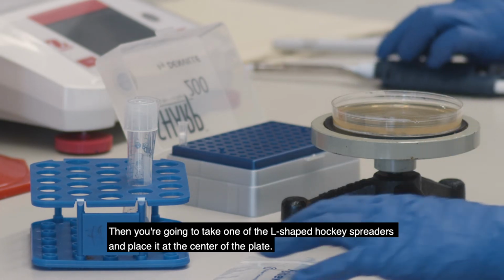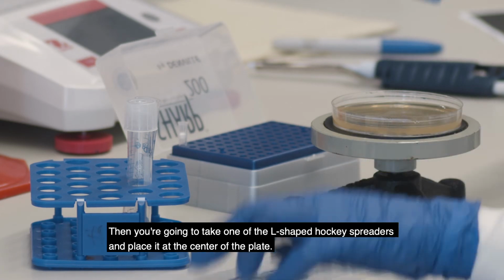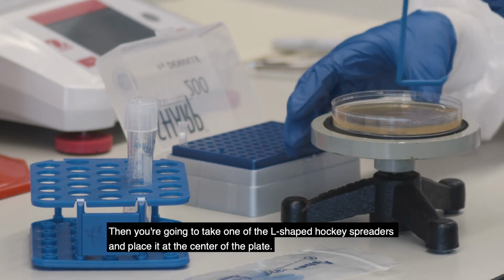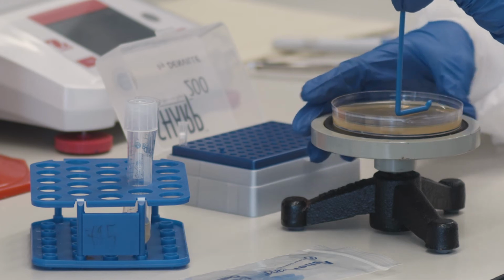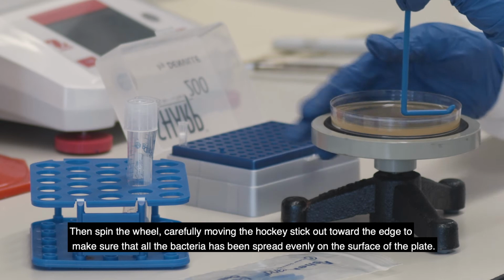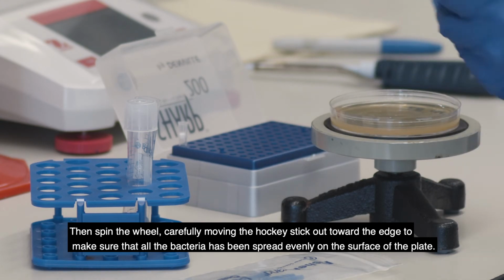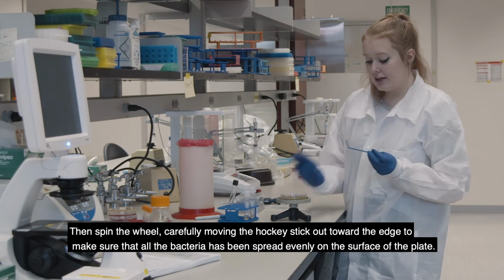And then you're going to take one of the L-shaped hockey stick spreaders and just place it at the center of the plate, and then spin the wheel, carefully moving the hockey stick out towards the edge to make sure that all of the bacteria has been spread evenly on the surface of the plate.